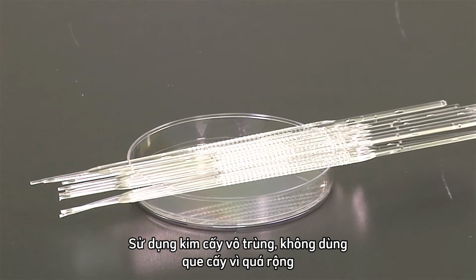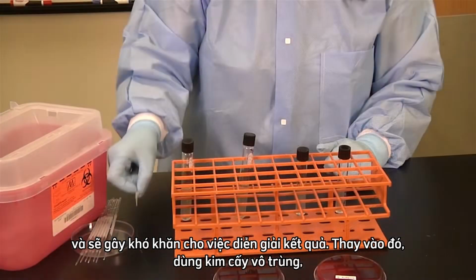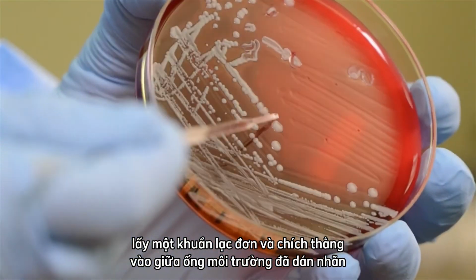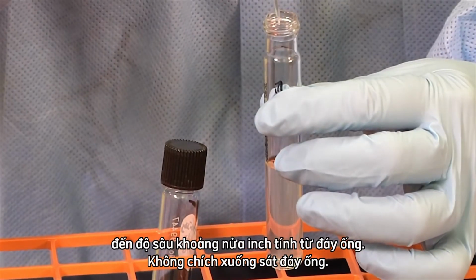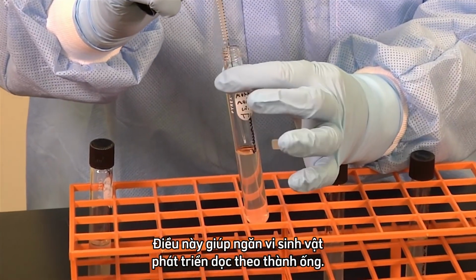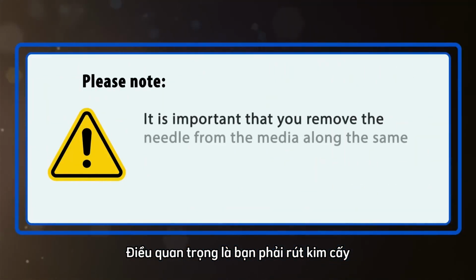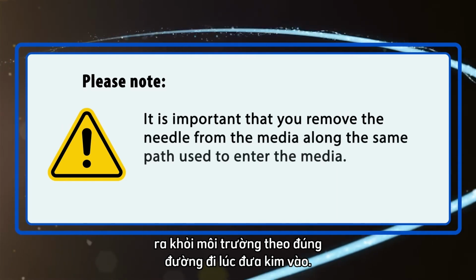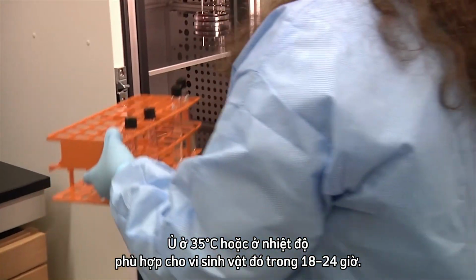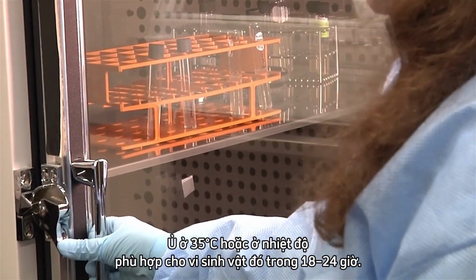With a sterile inoculating needle, do not use a loop because it is too wide and will make it difficult to interpret. Instead, using a sterile inoculating needle, pick an isolated colony and stab the labeled tube medium straight down through the center to a depth of 1/2 inch from the bottom of the tube. Do not go all the way to the bottom of the tube. This prevents the organism from growing up the sides of the tube. It is important that you remove the needle from the media along the same path used to enter the media. Discard the needle in the sharps container. Incubate at 35 degrees Celsius or the temperature appropriate for that organism for 18 to 24 hours.